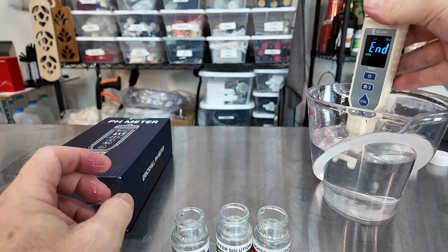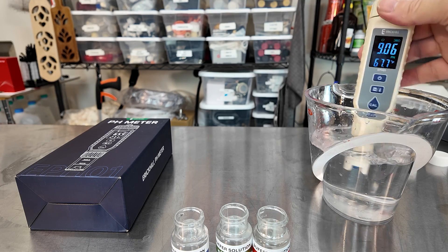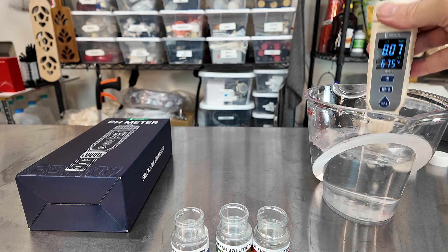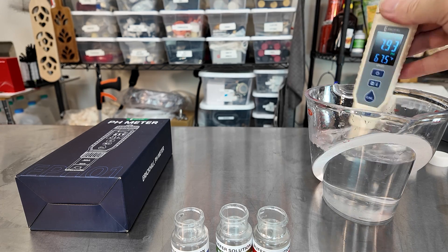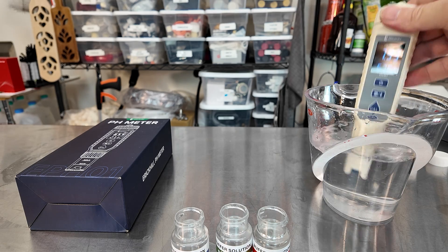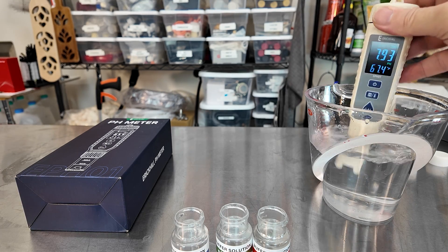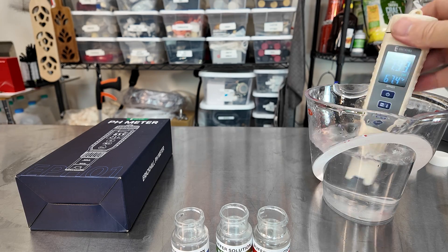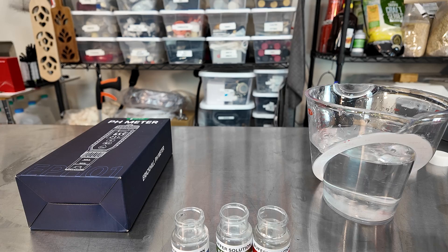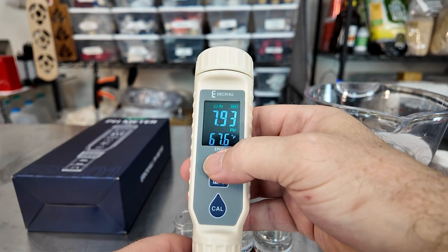Third... there's our fourth piece of pie, and we're gonna wait for it to finish. There we go — we're done. Remember to rinse it for a full minute. You can see it's bouncing around close to seven because it's distilled water — it's had a little bit of influence. I already have some solution in here for storage, so I'm going to put it in there and turn it off.